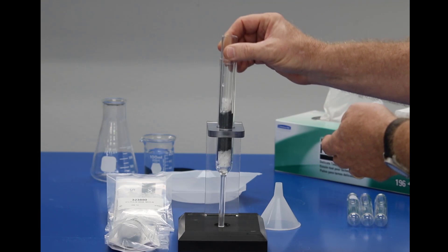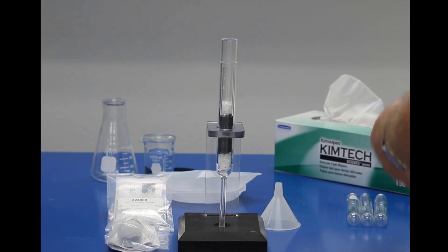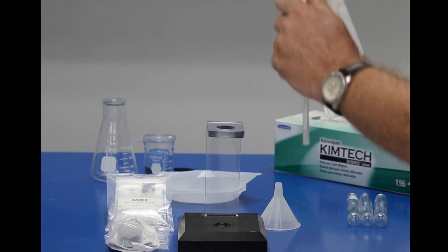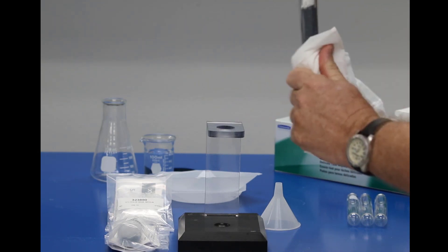So at this point, what I would want to do is, using my paper towels, go ahead and wipe it off just to make sure that it's clean.